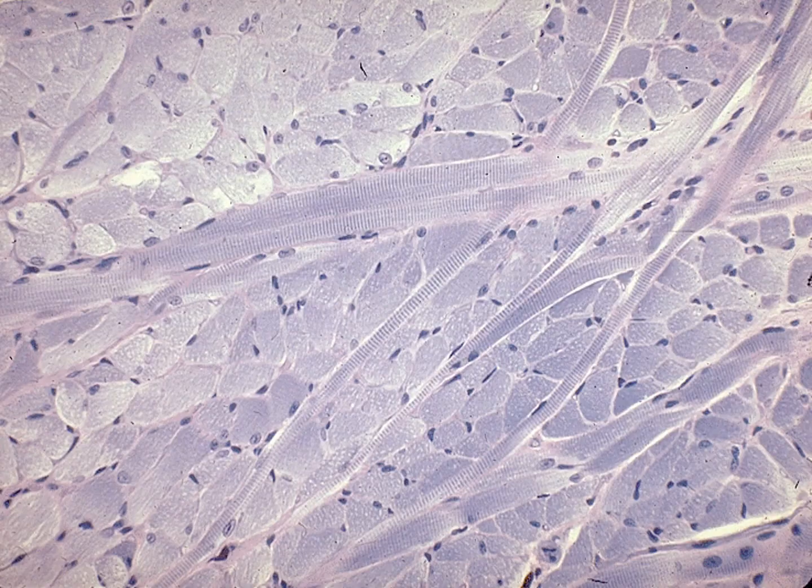So let's take a look at another one. Again, this striation pattern is the banding pattern, the light and dark banding pattern. And these dark spots, these are nuclei, which makes this tissue type full of multinucleate cells. Great picture here of skeletal muscle cells running through some other type of tissue. Here's a bunch of them running through.